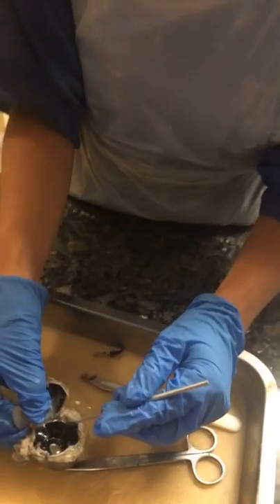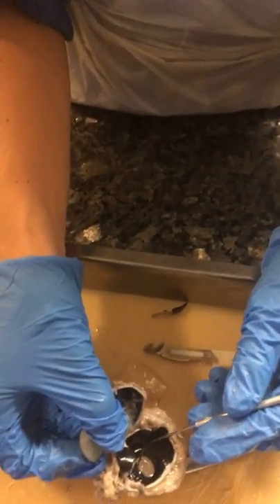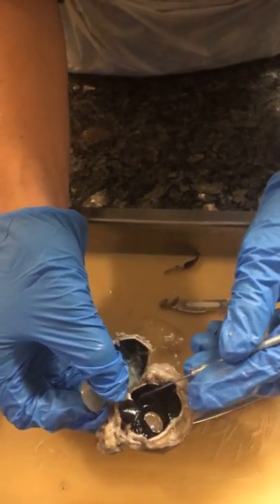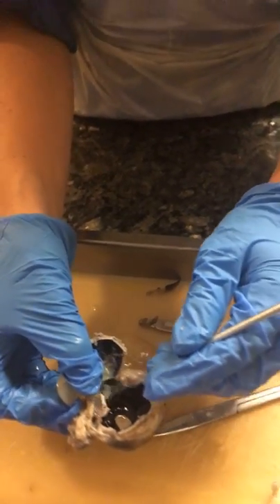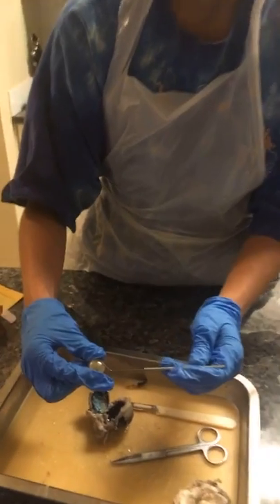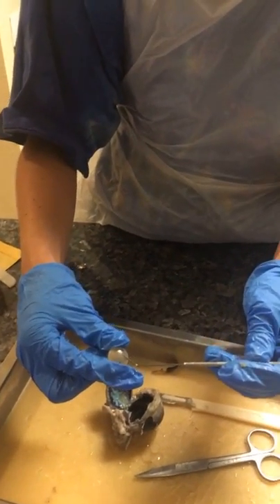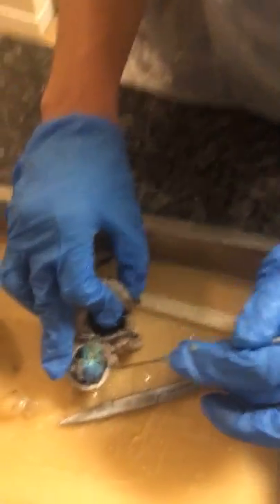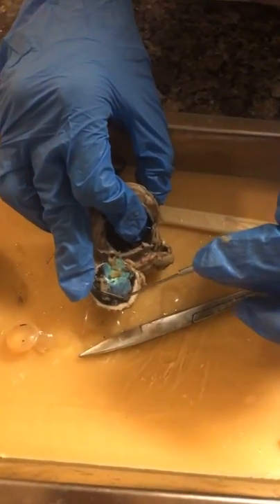And then here in the middle is the pupil, and around the pupil, the black stuff is the iris. And then here, I've removed it, we have the lens of the cow eye. So here we have the retina, and this is the choroid.